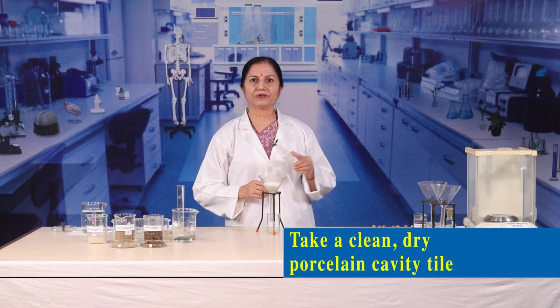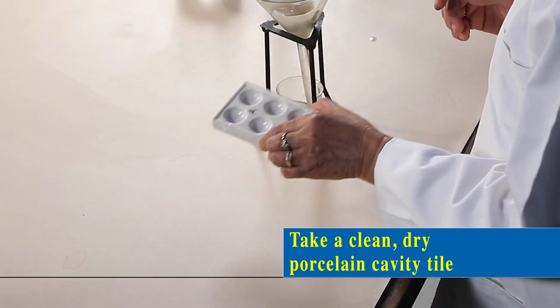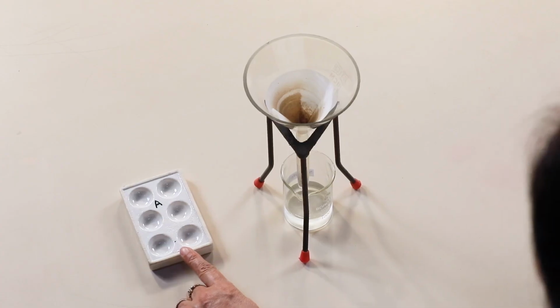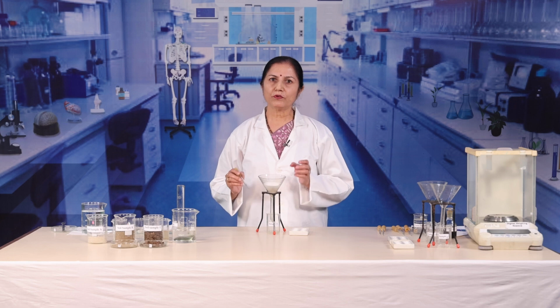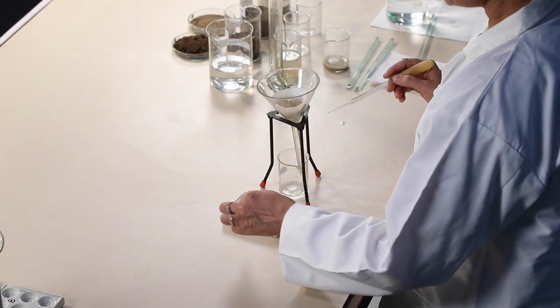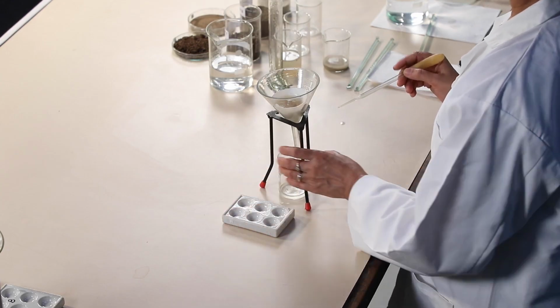Take a clean, dry porcelain cavity tile. Mark it as A. Place 5 drops of soil solution A in 3 cavities of the tile.